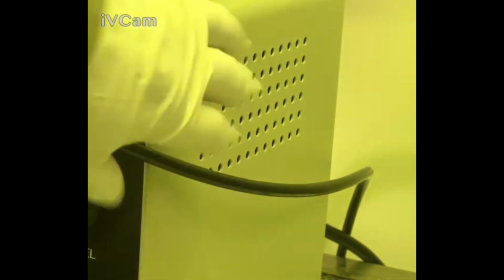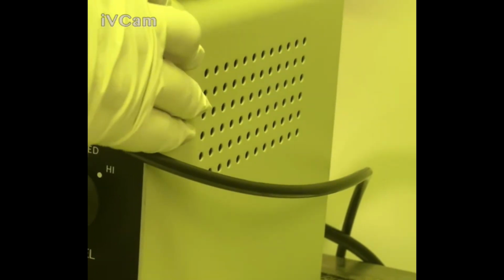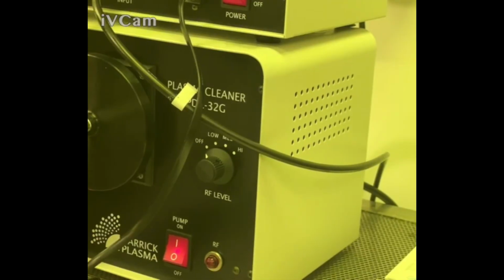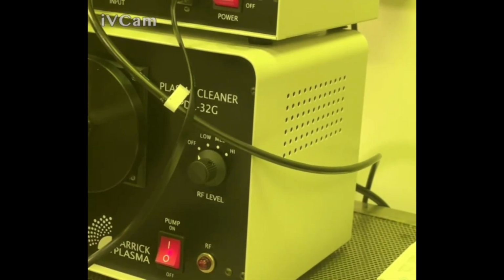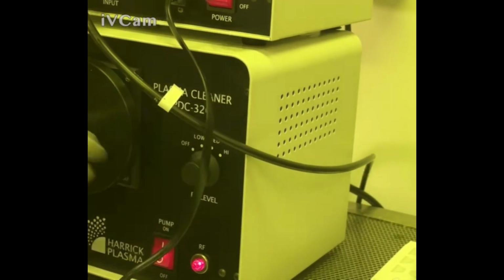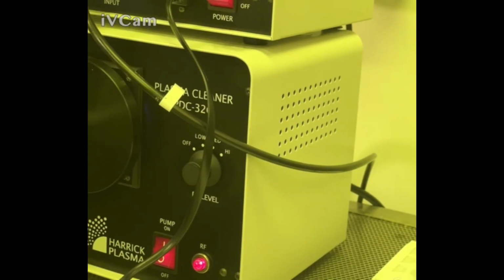And what's going to happen is when I turn the plasma treatment on, this section is going to turn kind of a purplish hue. You're going to see a purple light. Once I flooded it for 1 or 2 minutes, I'm going to set this to medium. Then I'm going to look at the side and see if I see a purple light. If I do, I'm going to set a timer for 45 seconds. If you come to the side, you can see kind of purple blue light. The moment that you see that light, you turn on the timer for 45 seconds. So far, I've had it running for 20.